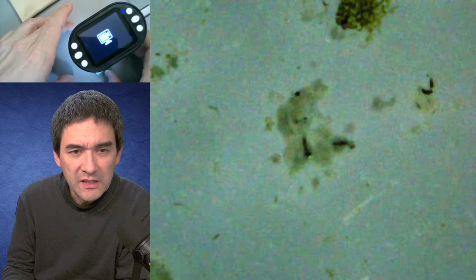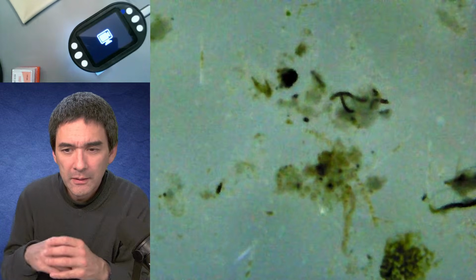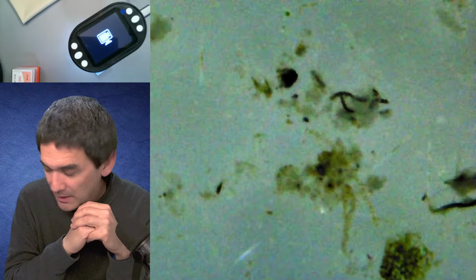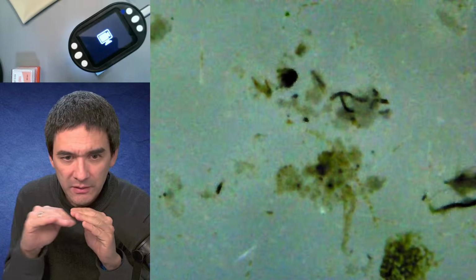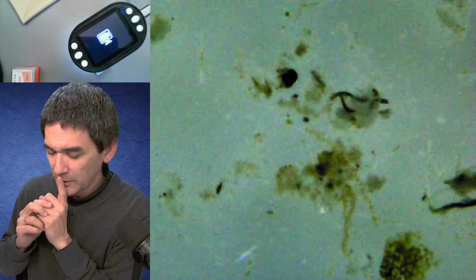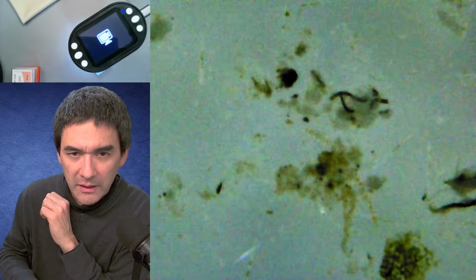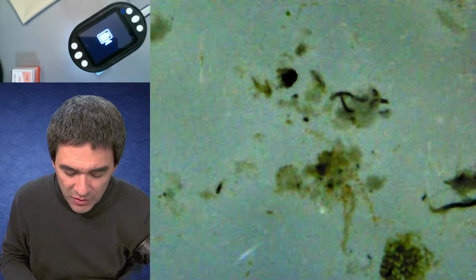And it's all pretty slow. If you actually notice, there is quite a bit of a delay. Phone as a backlight? Yes, I also considered that, but I don't have it with me now. That could be a possibility, maybe as some kind of diffuser. You know what I'll do? Maybe I'll try experimenting a little bit more, then maybe next week I can come back with some modifications to this.